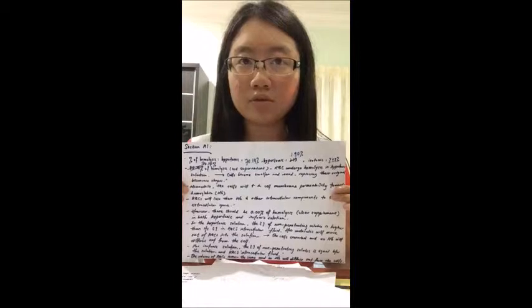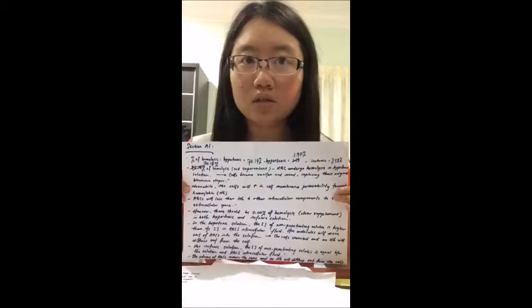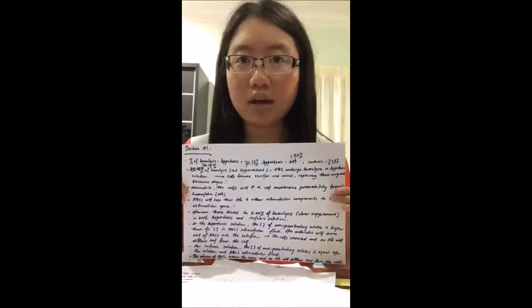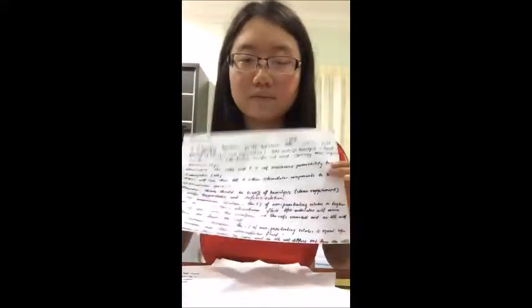The inaccurate results obtained may be due to human errors while handling the red blood cells. We might have accidentally transferred the erythrocytes that contain the hemoglobin, which are located at the bottoms of the centrifuge tubes, into the clean small test tubes for measuring the absorbencies of the supernatants. We also might have shaken the tube containing the blood sample and caused some of the red blood cells to rupture. Other than that, the surface of the plastic container might not have been cleaned properly. So this may increase the readings as the transmitted light cannot pass through the unclean surface easily, resulting in a higher value of absorbency.